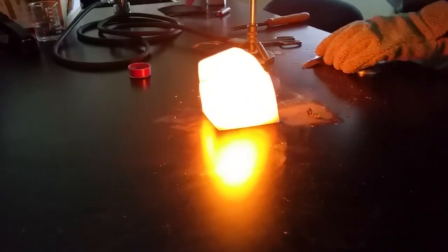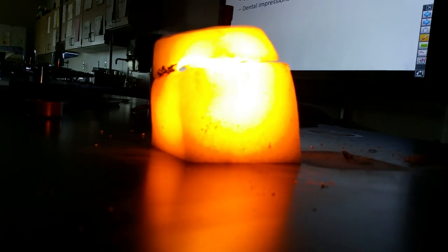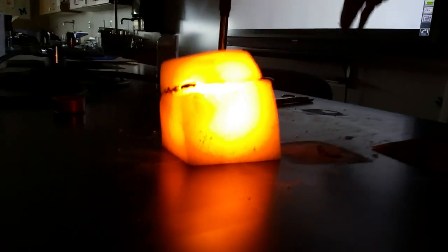What is that yellow? It's yellow. It's glowing. It's red hot. Take it off real quick so we can see it. In physics, this would be black body radiation. Yeah. Right? It's getting so hot that it's getting hot enough to emit light.